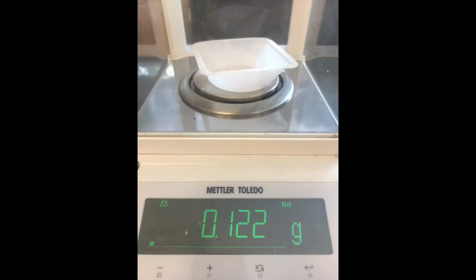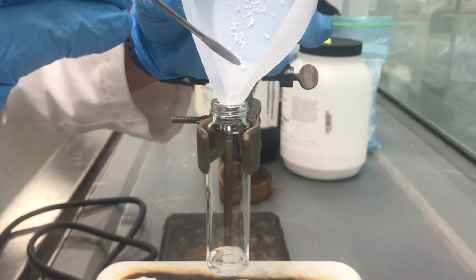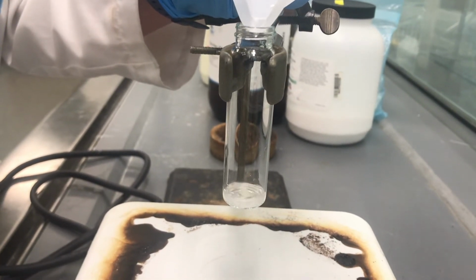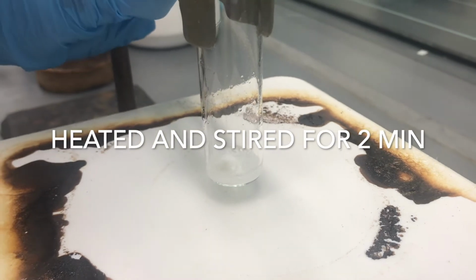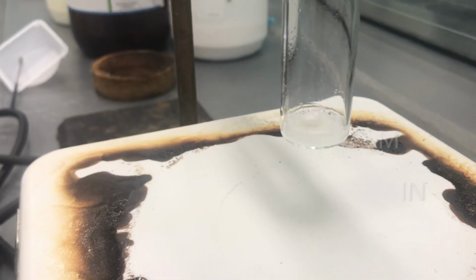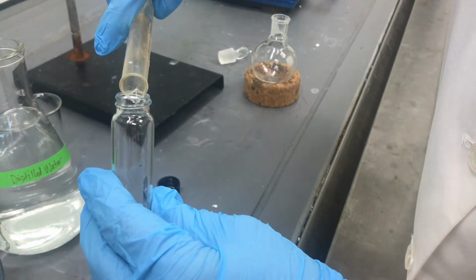Make sure you don't leave the cap off the bottle of sodium borohydride. When the borohydride is added, boil the contents of the vial on a warm hot plate at the lowest setting for 2 minutes. This is me cautiously and intermittently adding my sodium borohydride. Now I'll let the reaction cool for a few minutes and then carefully add 3.5 milliliters of ice water.